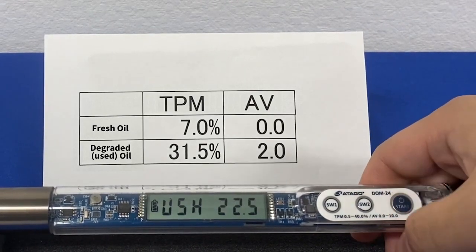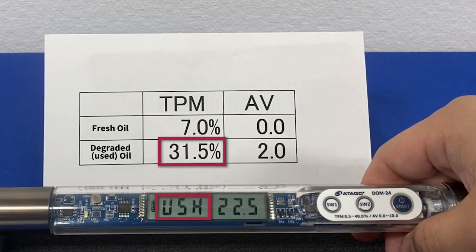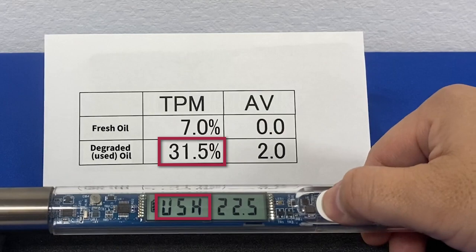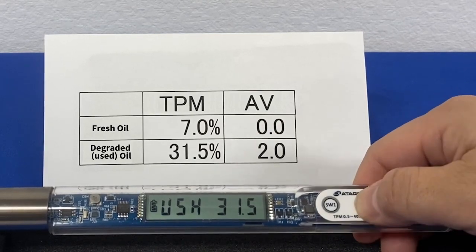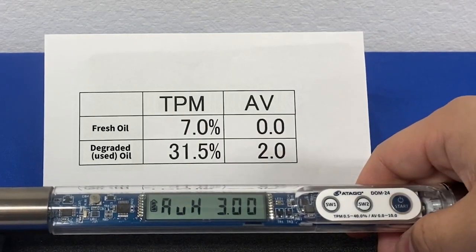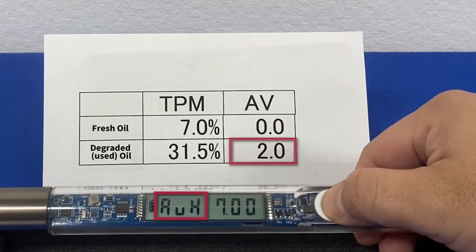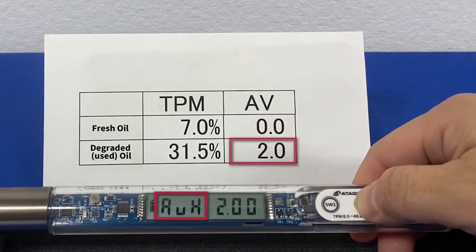Next is USH. Here, enter in 31.5%, which was the value of the degraded oil from earlier. Next is AVH — enter in 2.0 for the acid value of the degraded oil, and press start.